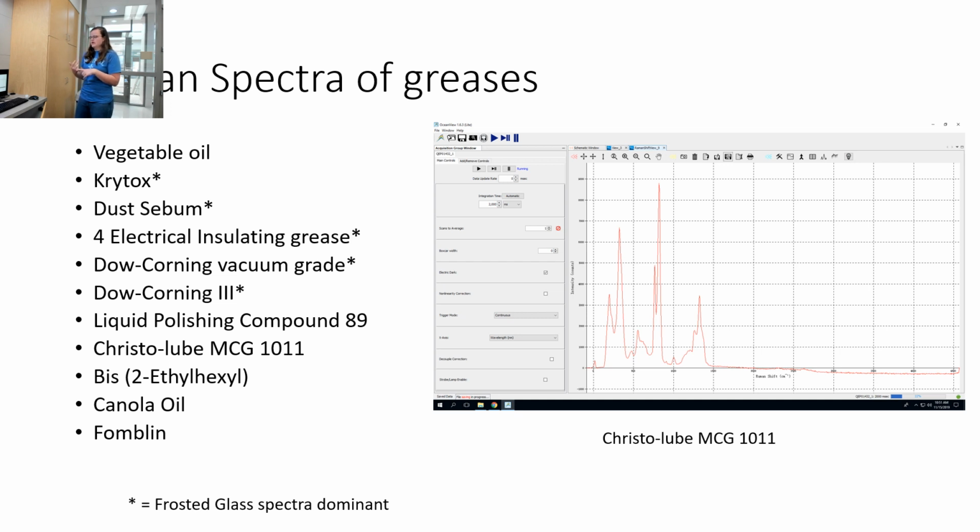I did aluminum foil, same problem. I did anodized aluminum, and I think that was pretty much the same problem. So I've also been trying to look into whether there is silica in these greases, because that would explain why the frosted glass spectrum is showing up, since it is a silica-based microscope slide. And then the bottom 5 are all liquid greases.